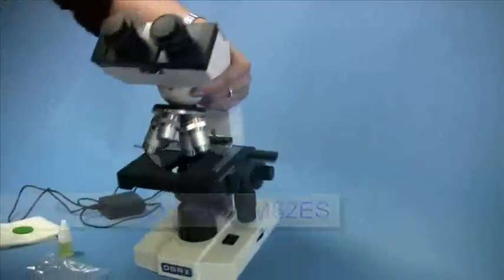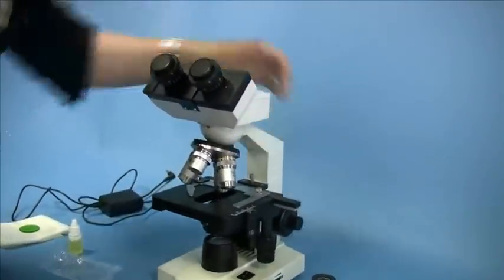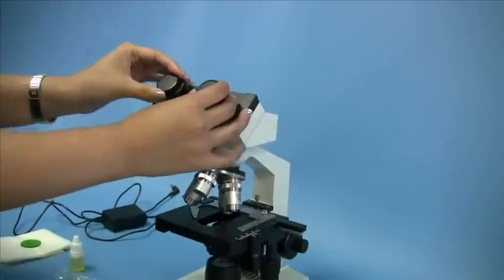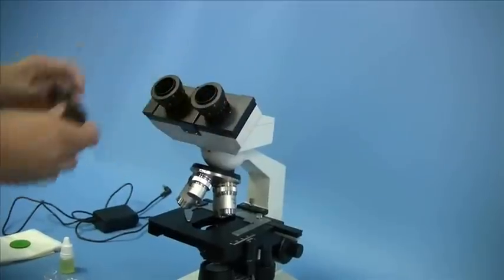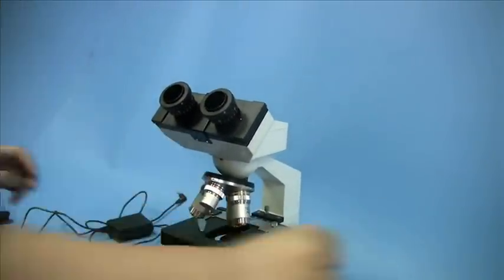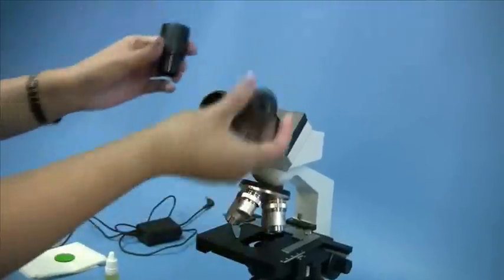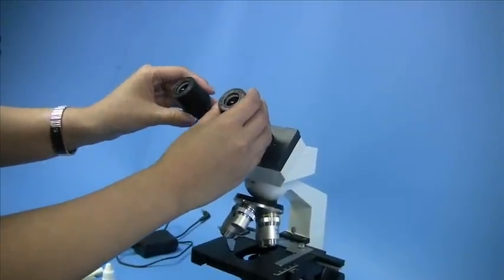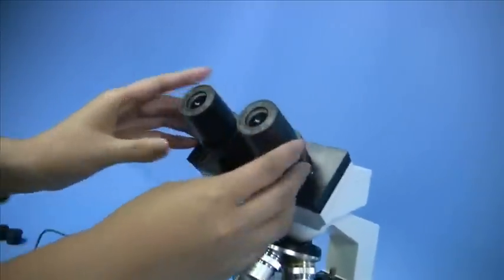Now the eyepieces. It is very important to make sure to remove the cap on the eyepiece tubes, and simply take a pair of eyepieces and place them in the tube.